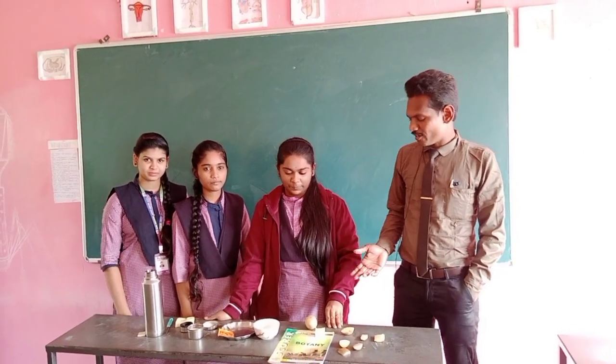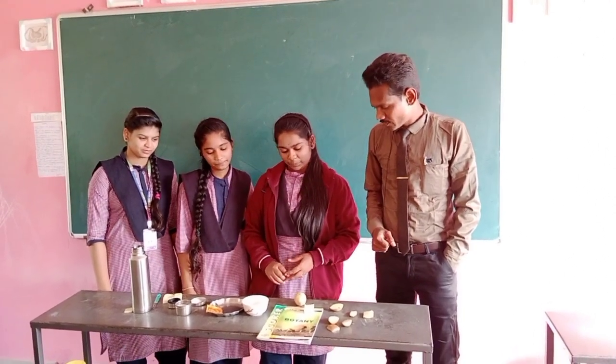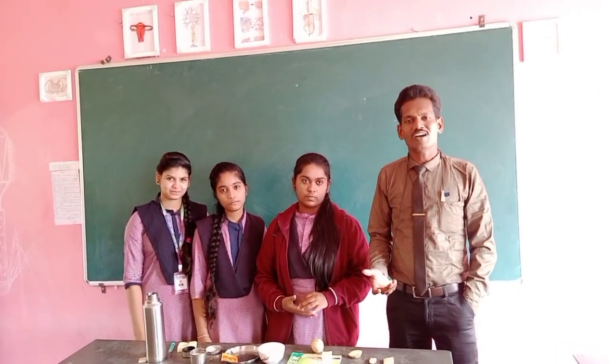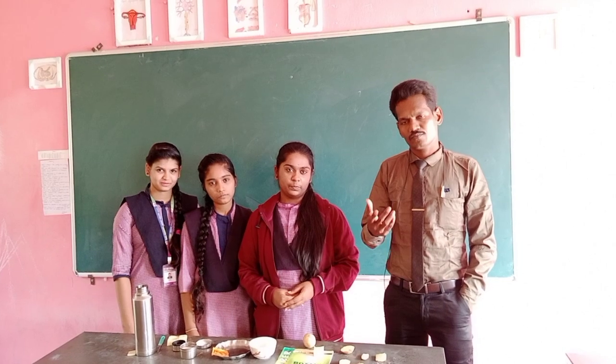So here we have our team members who are going to demonstrate an activity. All the apparatus are arranged here, and we are eagerly waiting. What activity are we going to do? What is the procedure, aim, principle, and process? We shall watch in this video. Our team members will lead this activity.